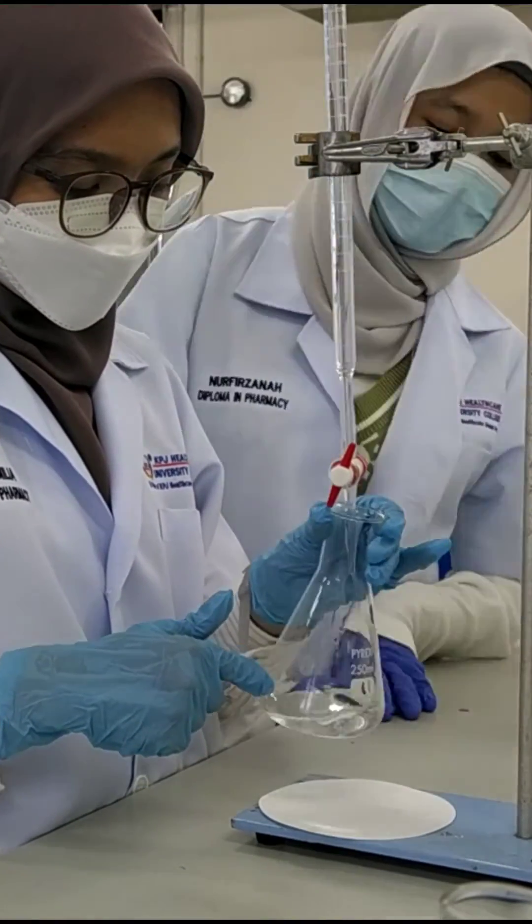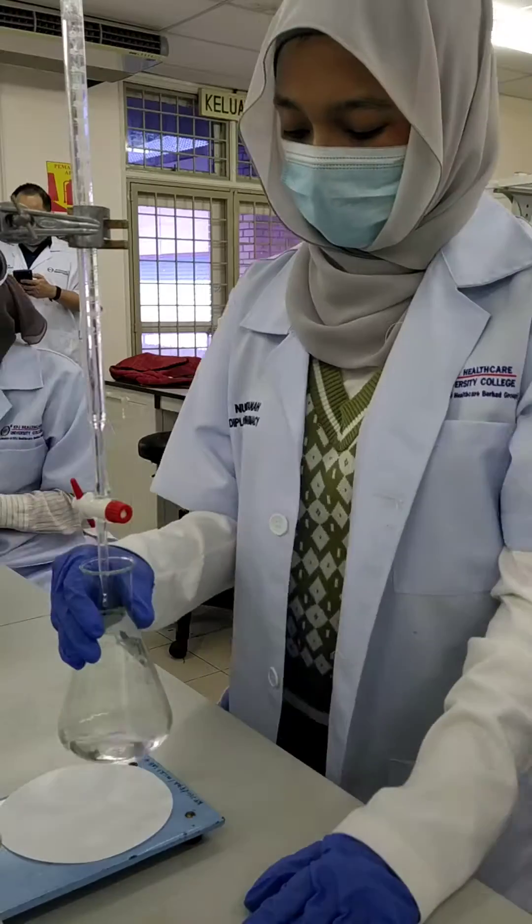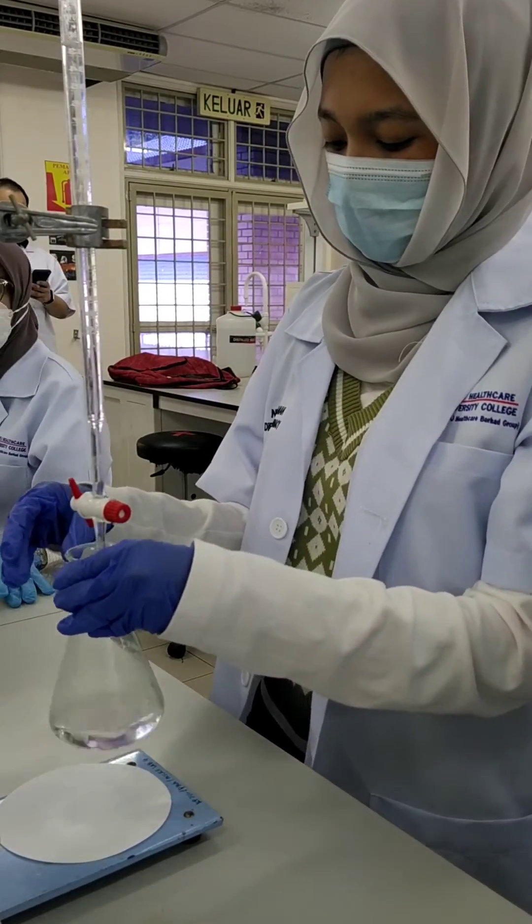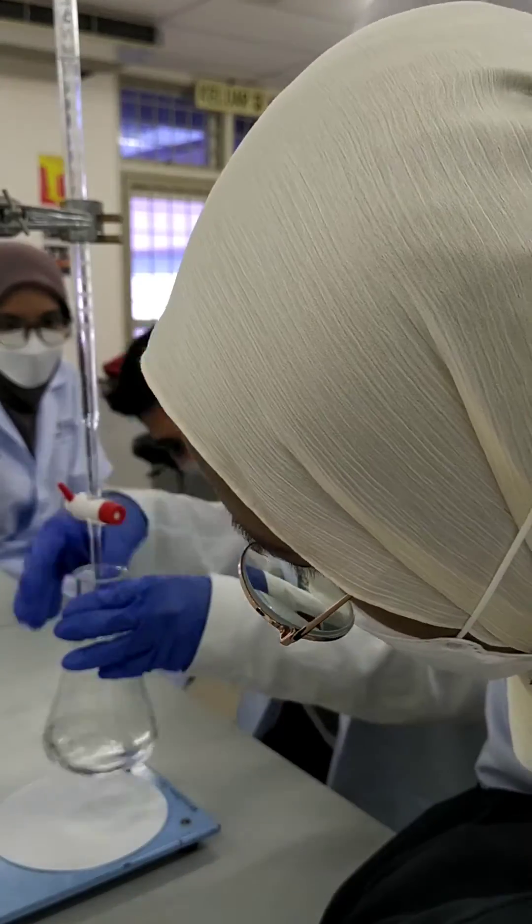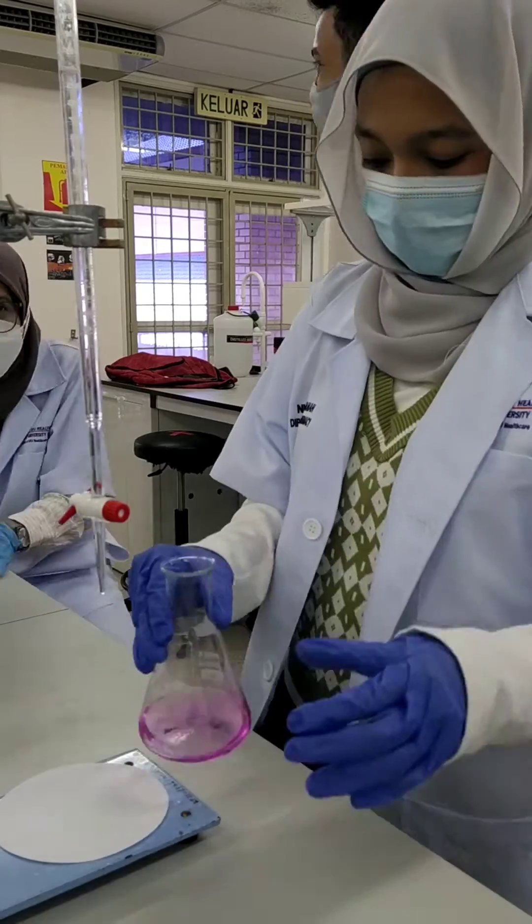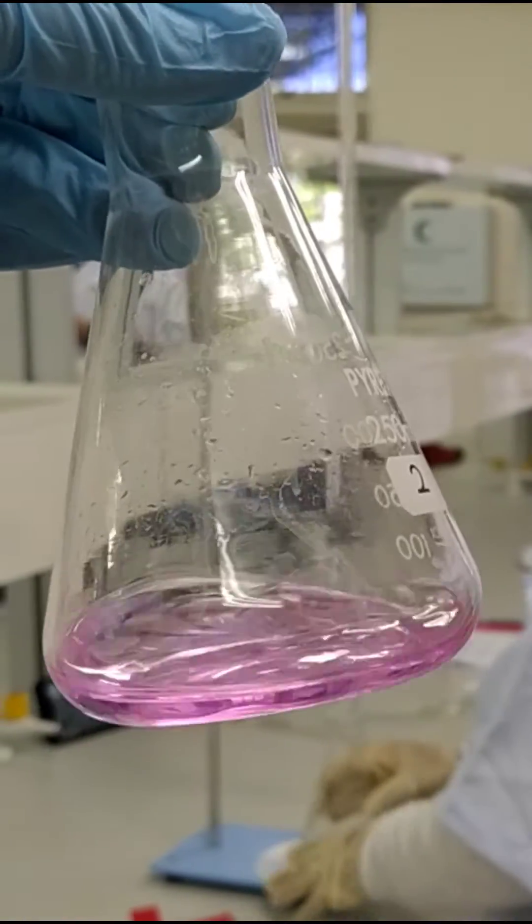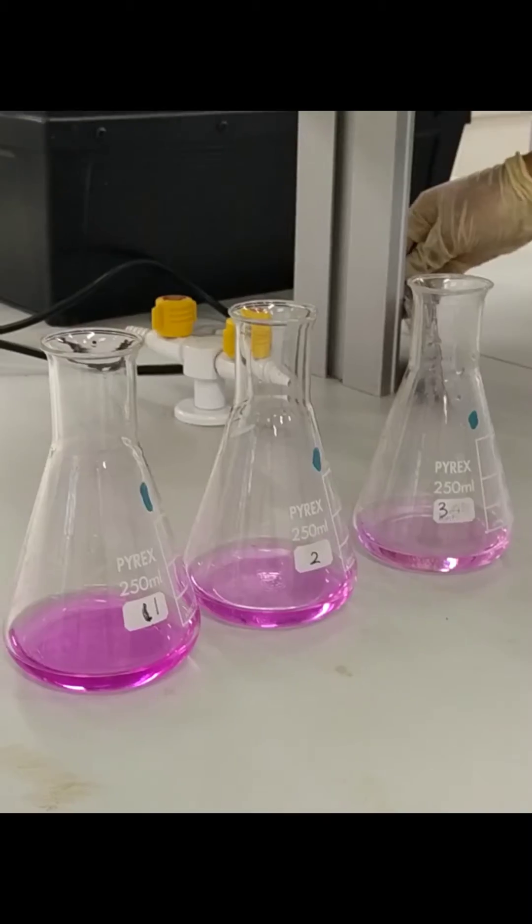Repeat the titration with all your duplicates and make sure all of them are faint pink in color. As you can see, this is what we want. A very faint pink, light pink, not too bright.